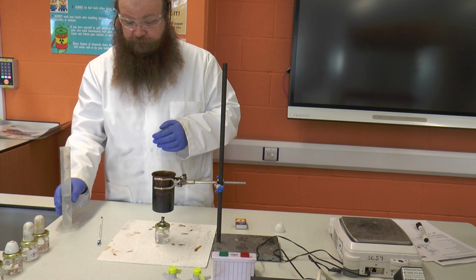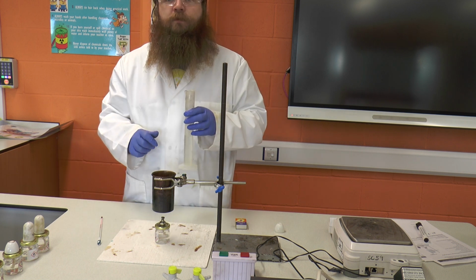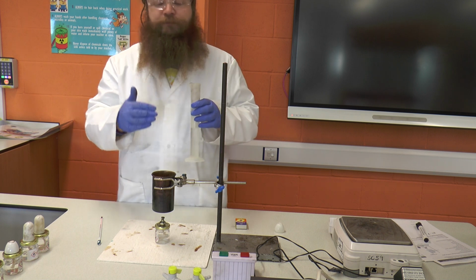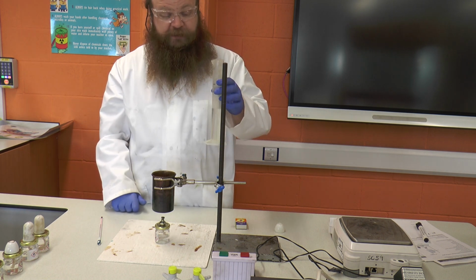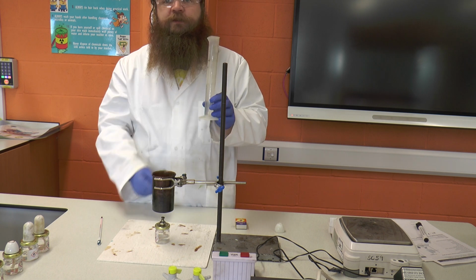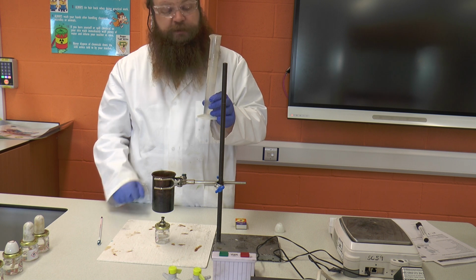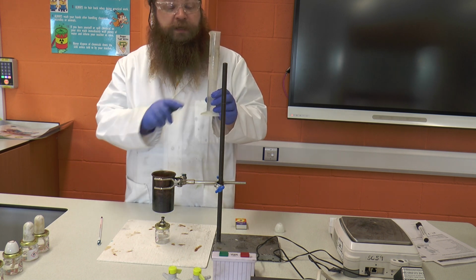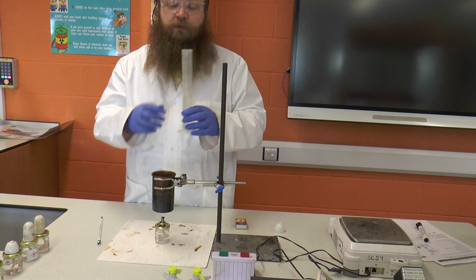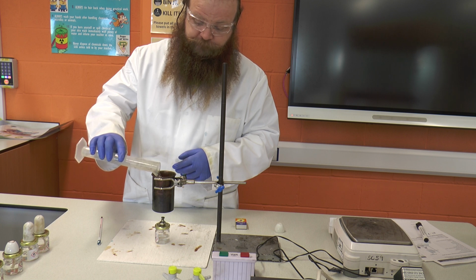The next thing I'm going to do is, we said we're going to heat water, so we're going to measure the temperature change by heating of the water inside the calorimetric can. To keep that constant, we're going to use fresh normal room temperature water each time, and we're going to use the same volume. So we've got a measuring cylinder and we're going to accurately measure 50 ml of water, which we're going to place in to the bottom of our can.